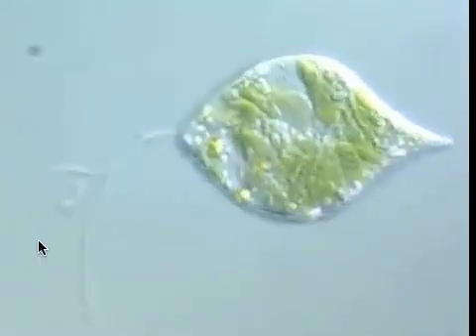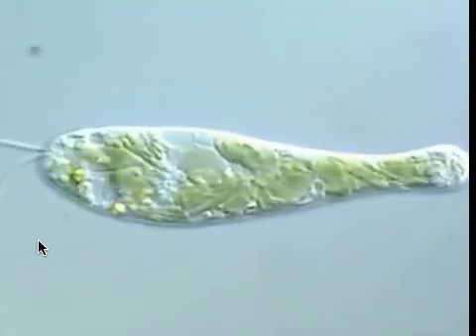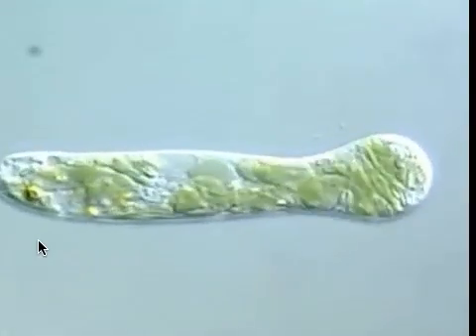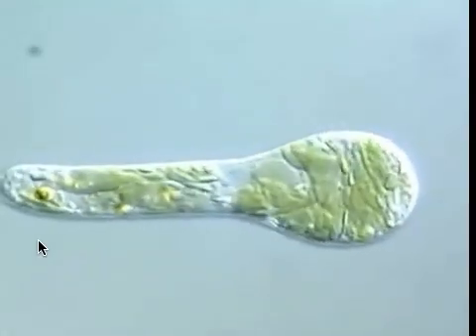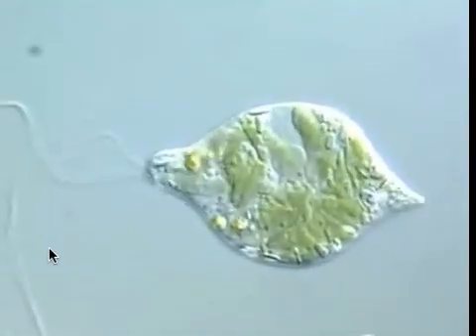This is under high power, so they'll be very small under low power. But as soon as you see those green specks and increase the magnification, you'll be able to see the euglena in more detail.